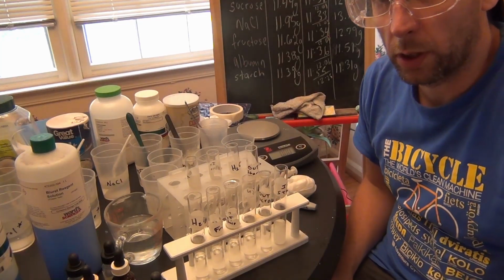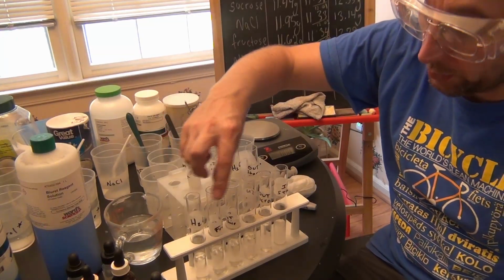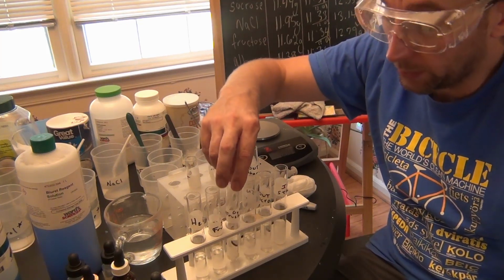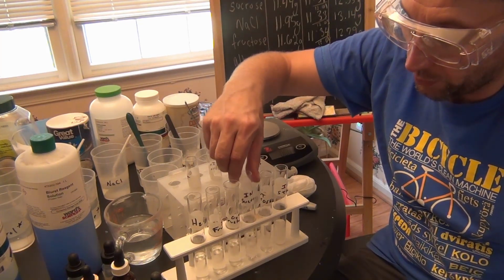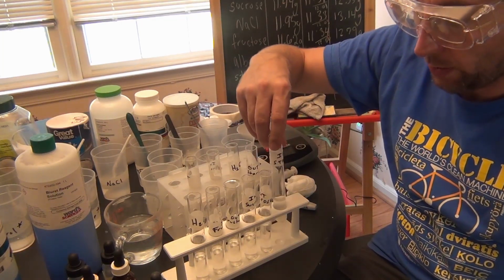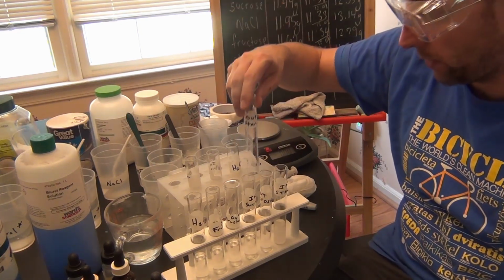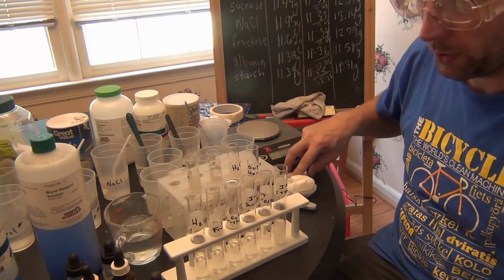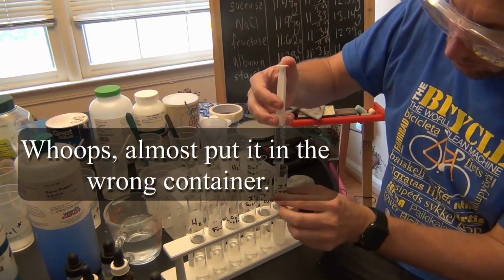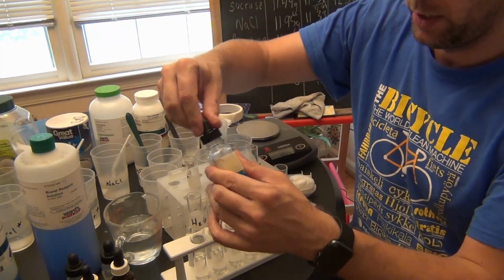So to test for sugars, again I have water, I have the original fructose solution that went in the dialysis tubing, and I have the solution outside the dialysis tubing, so we're going to see if things got transported out. I have sucrose inside the dialysis tubing, and then what was outside. Then I also have starch originally inside, and then starch on the outside. I'll fill that in a second. Okay, so we do the same thing for this test. We add a dropper full.